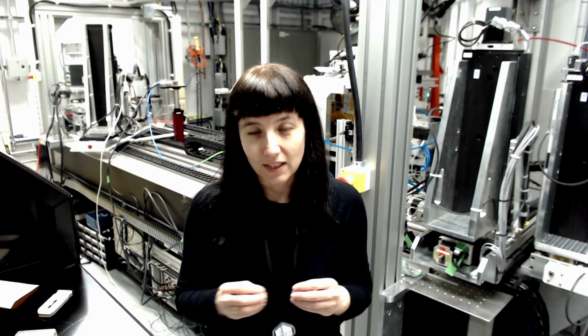As an example, I will quickly show you a sample which is actually a very thin section through a very tiny zebrafish larva. This is from a project that I was working on in the past, and we were looking at the methyl mercury compound and its accumulation inside zebrafish larva. Our interest was detecting tissues that take the most of this toxic compound, because this way we can find out which tissues are the most susceptible to mercury toxicity.